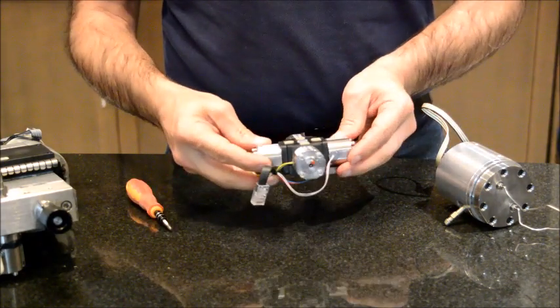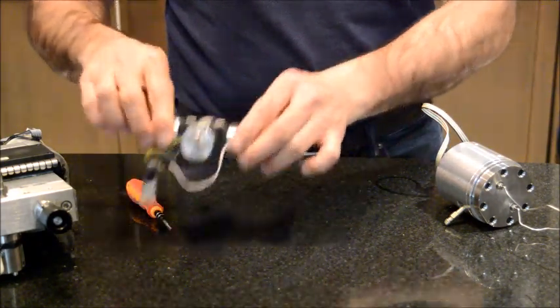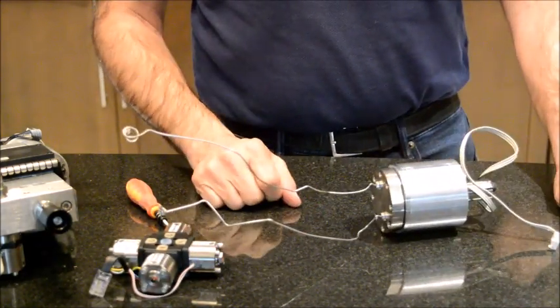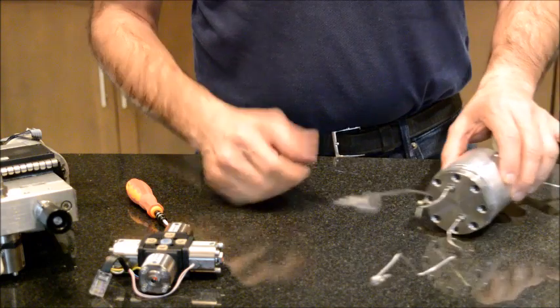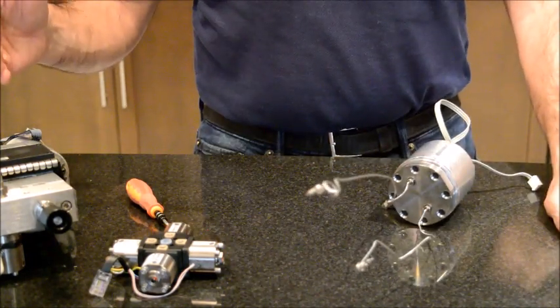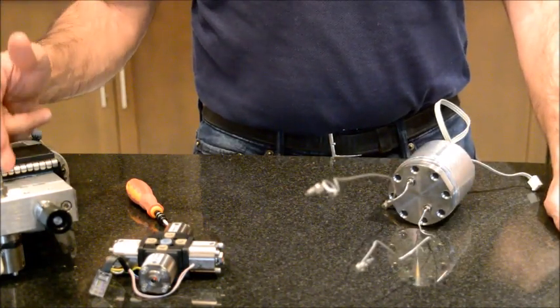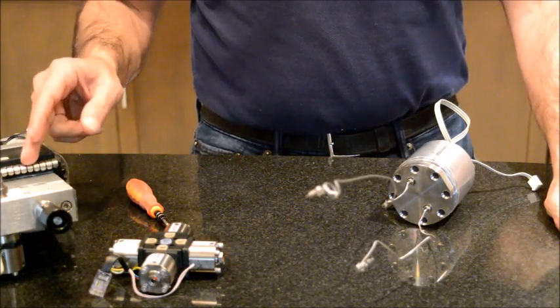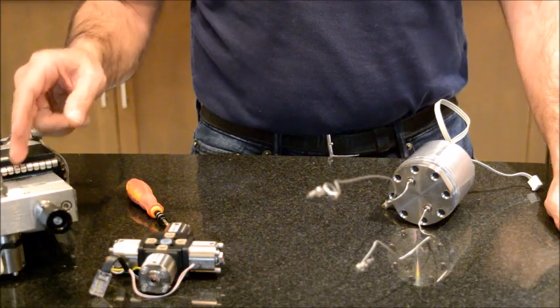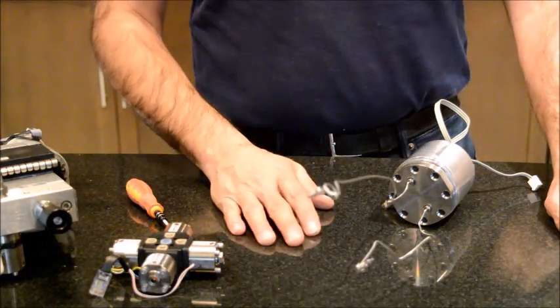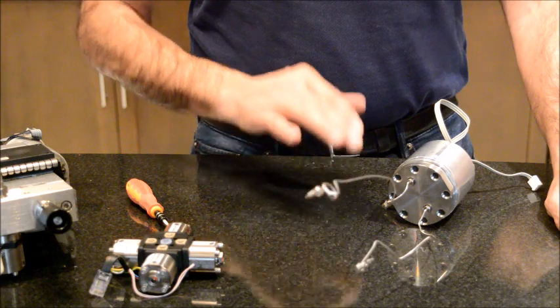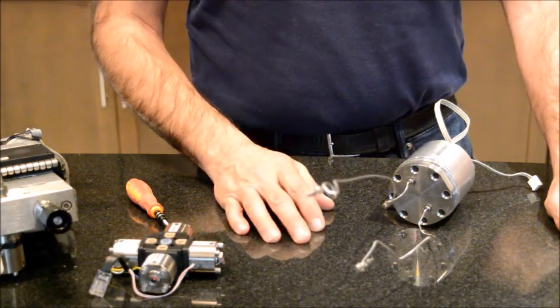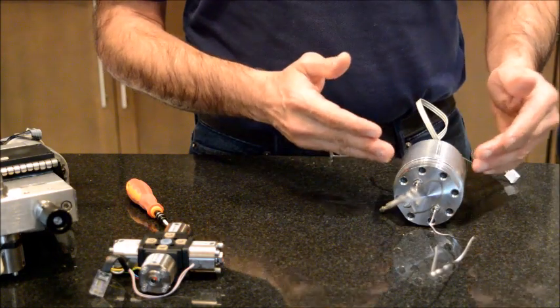This is all I wanted to talk about the gradient proportion valve. I'm going to put this aside. I'm going to talk briefly about the flow damper. The function of the flow damper is to take the mobile phase flow, which has a frequency to it—this pulsation, this pulsing—into a mobile phase or a flow which is continuous and is non-pulsating.